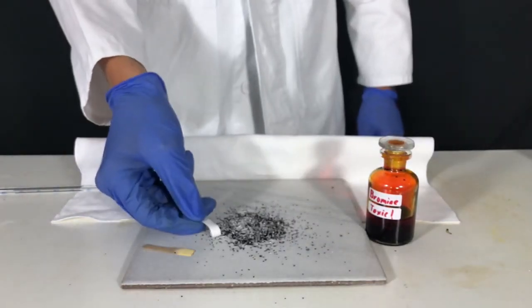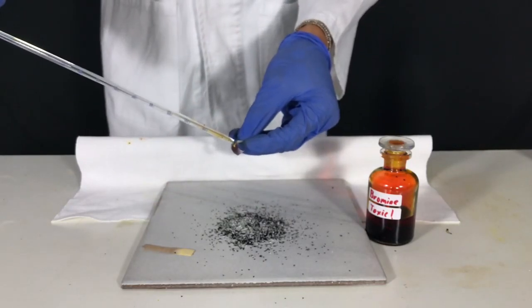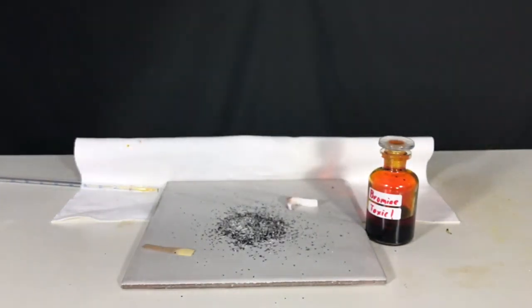To show the absence of bromine vapors, I held another piece of potassium iodide starch paper above the bromine spill. It didn't change its color before I held it against our pipette, which was still contaminated with bromine.